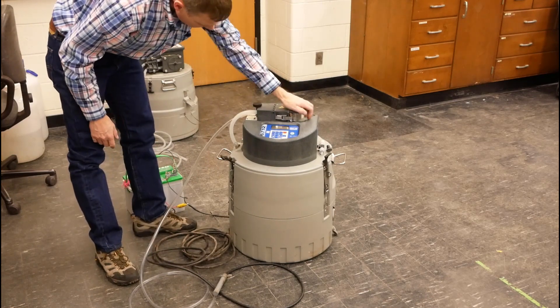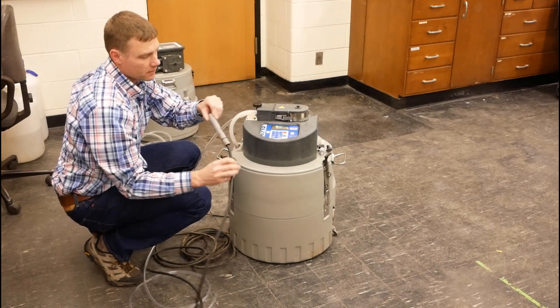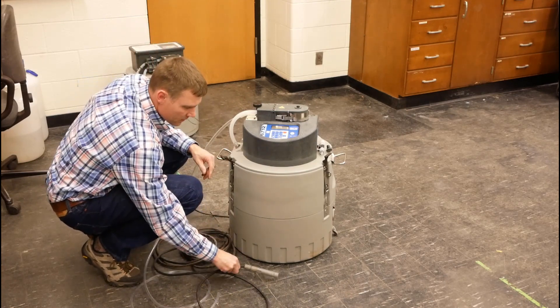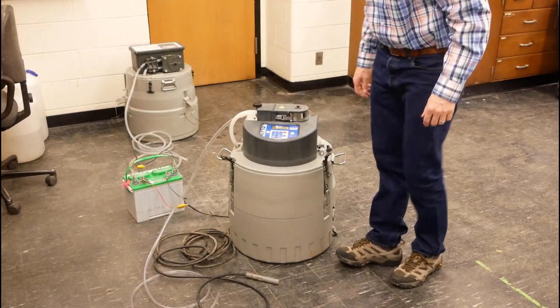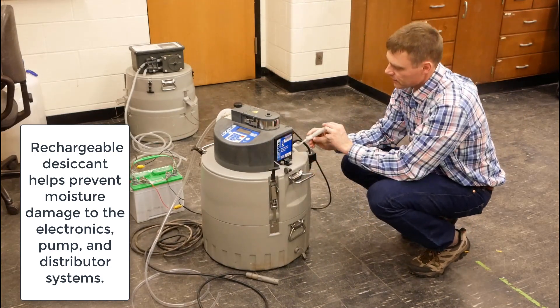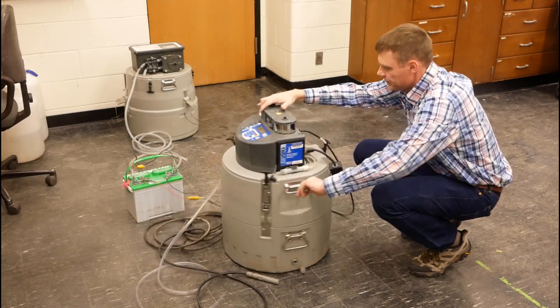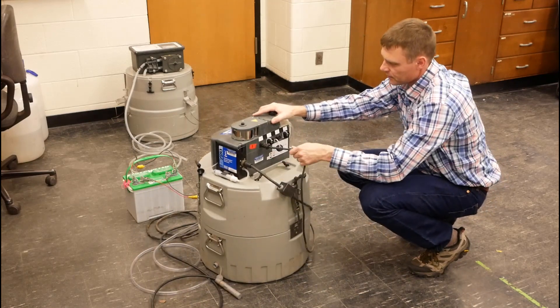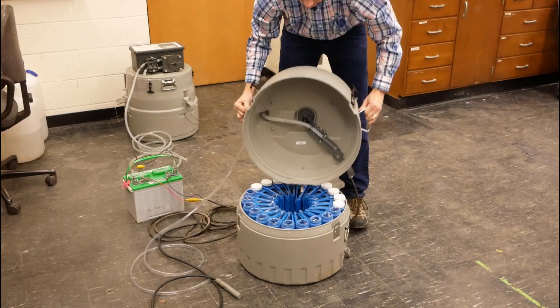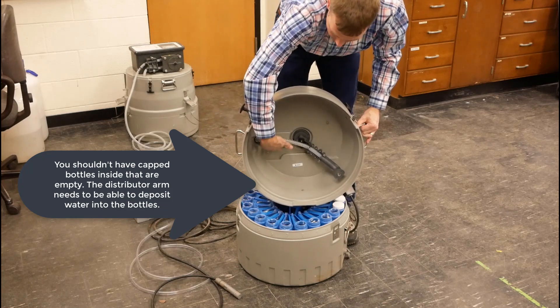The pump is located at the top of this model. This model also connects to a flow sensor, so we can do flow composite sampling with the 6712 model. This is called a 720 module, which is essentially just a pressure transducer. The next component is the desiccant. That's the distributor arm, which swings around inside to fill individual bottles at the given time.